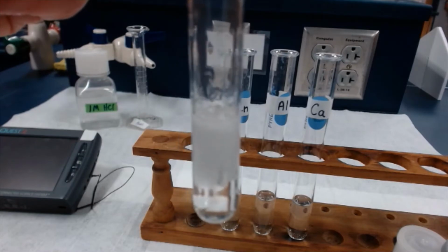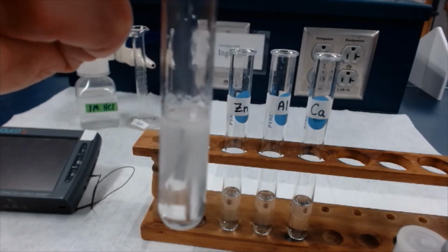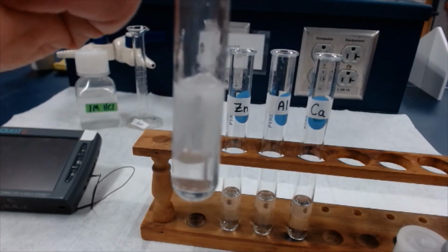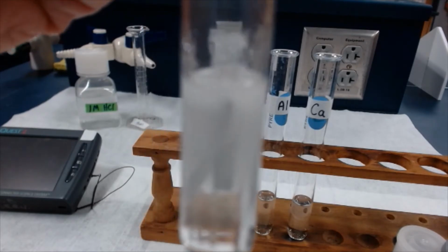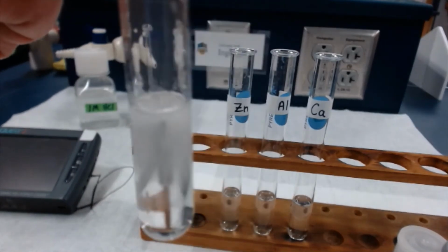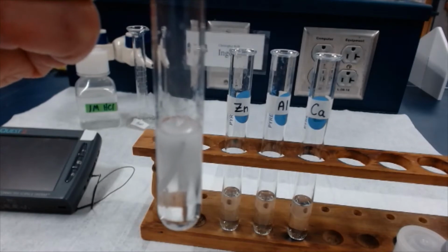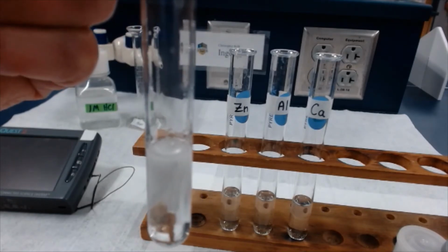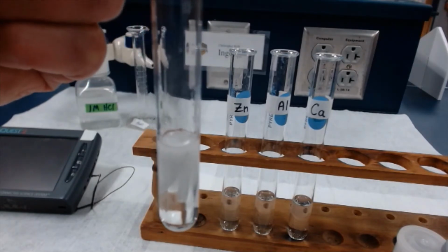Okay, you guys can observe what's happening to the magnesium as soon as I dropped it in. I'm going to be quiet. Hopefully you may be able to even hear what's happening in the test tube. If you can't hear, I can hear a little bit of a hissing noise that's coming from the bubbling of the magnesium in the acid. Okay, so I've started timing this, and it says to let it react for about 3 minutes. And so again, I'll stop the video and I'll come back.